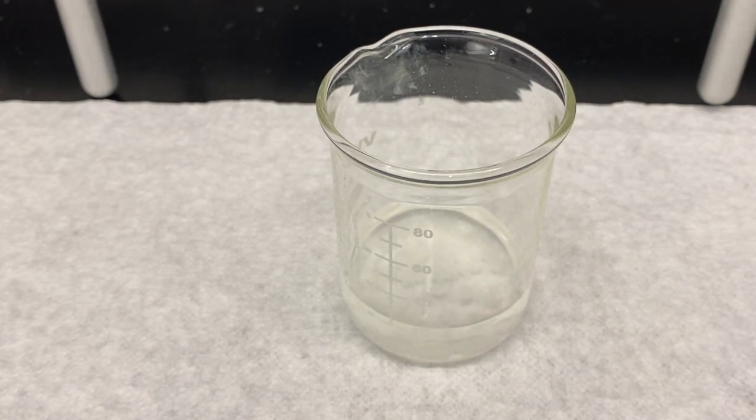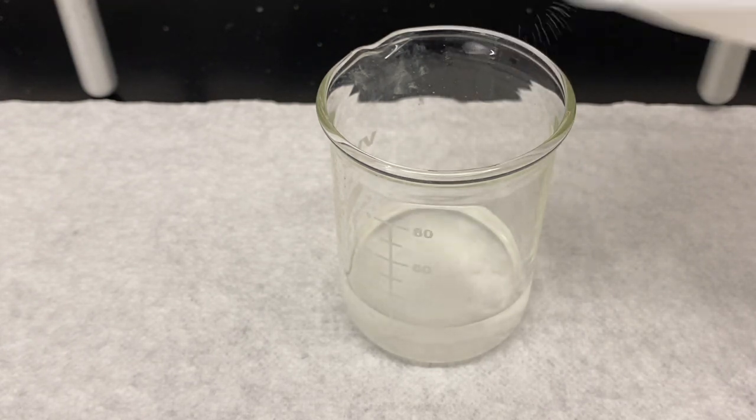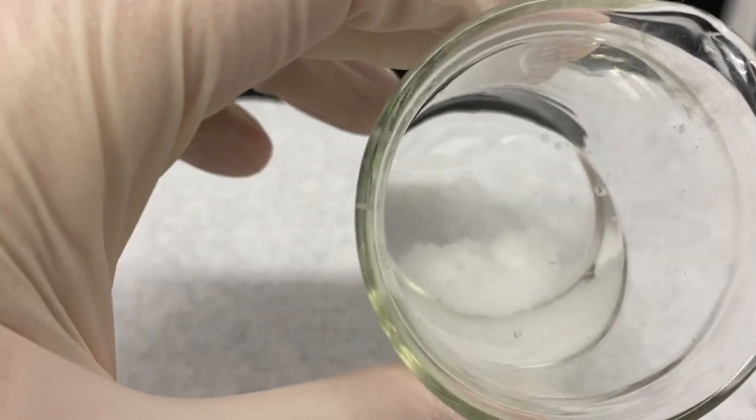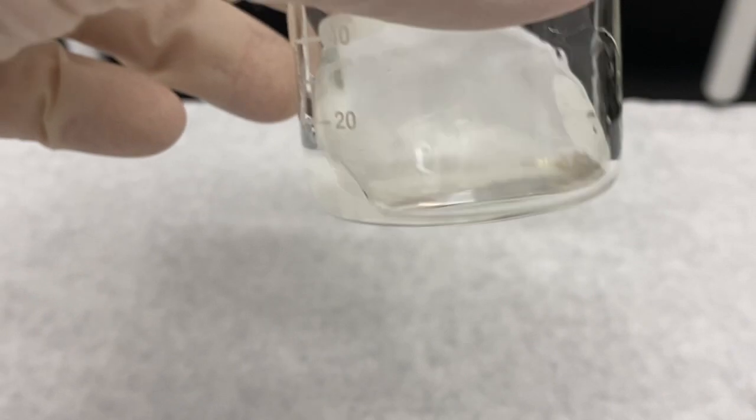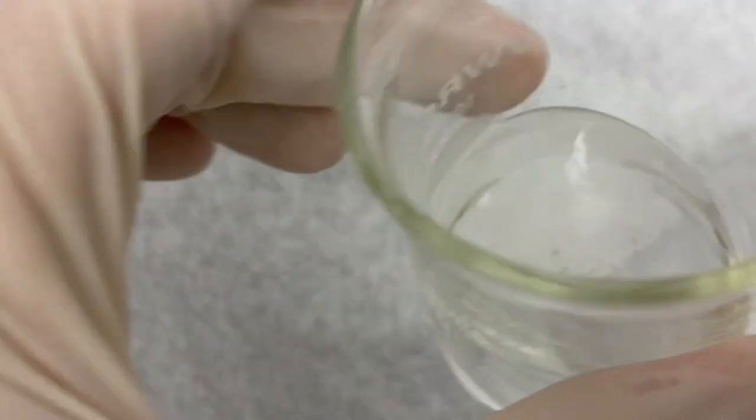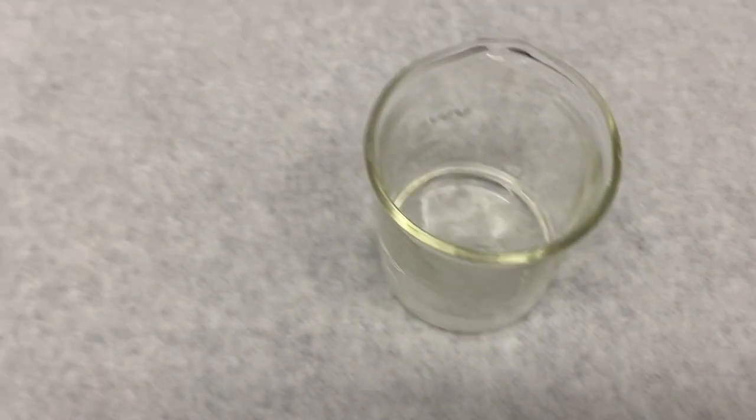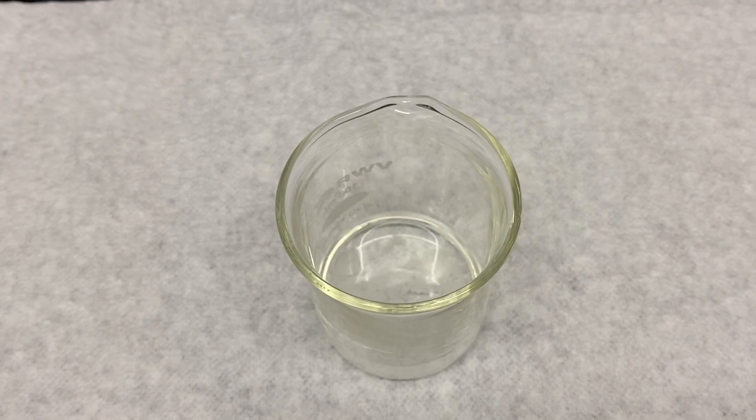I'm going to need to add a little bit more to get this fully dry, so I'm just going to add a little bit more. I've got about five grams here. I'm not going to add all of it, just some. And what we're looking for is when we swirl it, if we see loose particles. We're a little bit better where you can see that it moves around nicely. So that should probably be good. So now we have to filter off the solid and then evaporate the liquid.